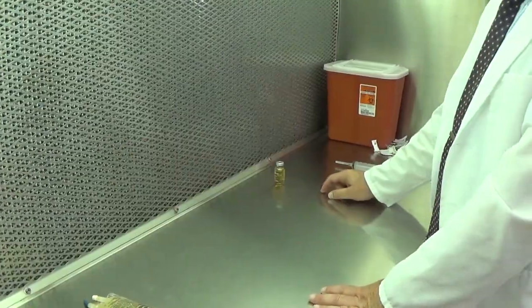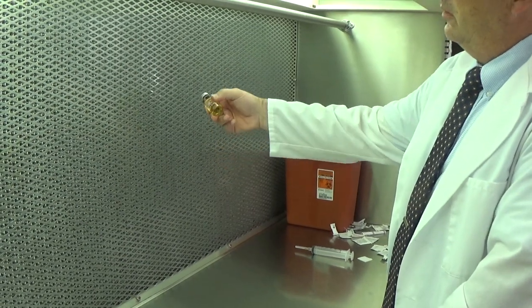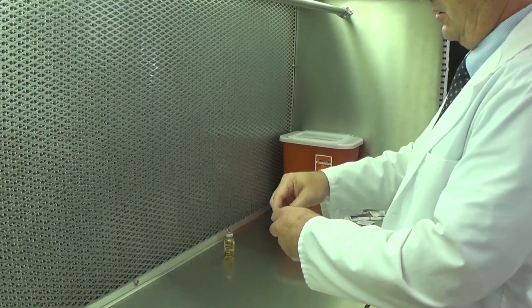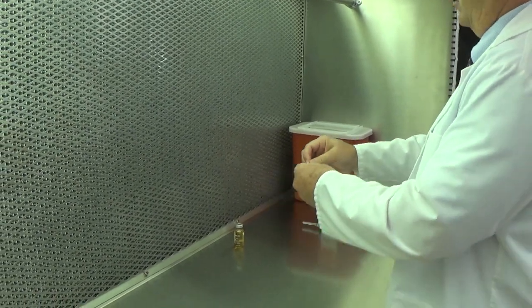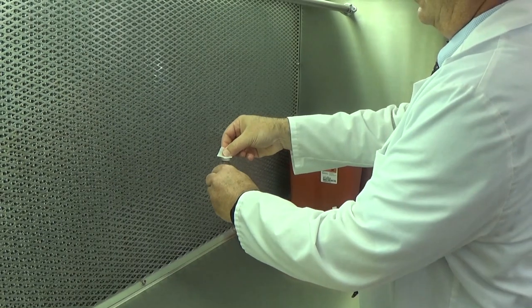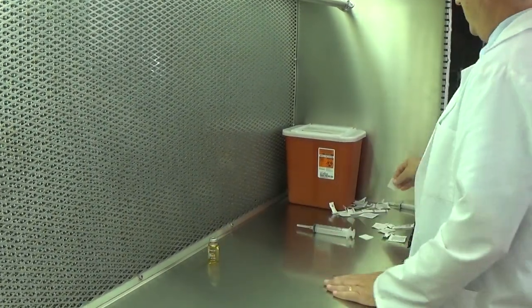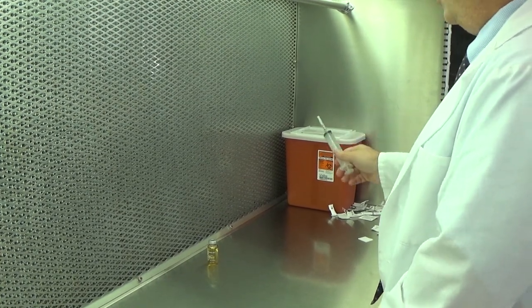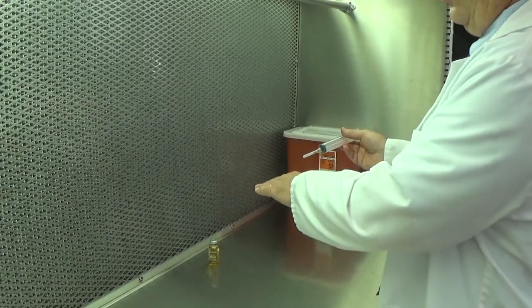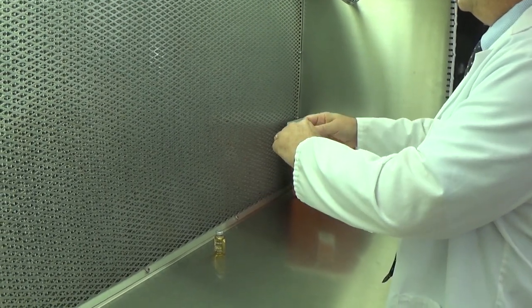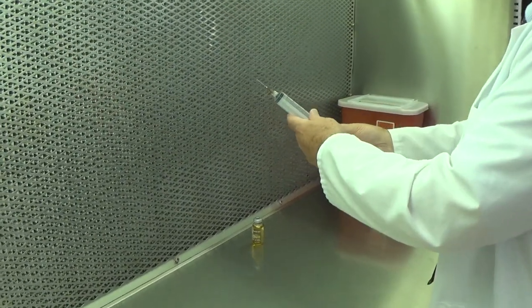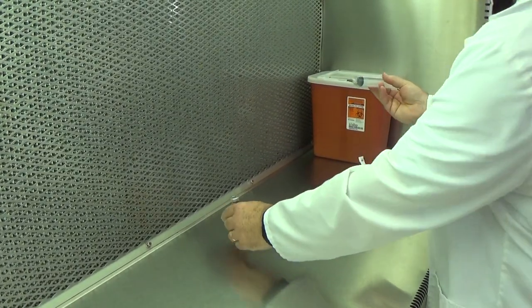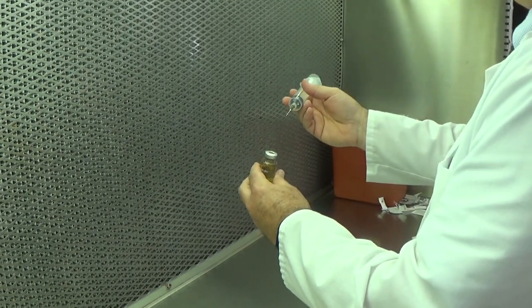My dry powder is fully reconstituted. I'm assured adequate mixing. I'm going to re-sanitize the critical site and set it in first air to dry. My needle and syringe is the same one I used earlier, because it's only been in contact with that one ingredient.